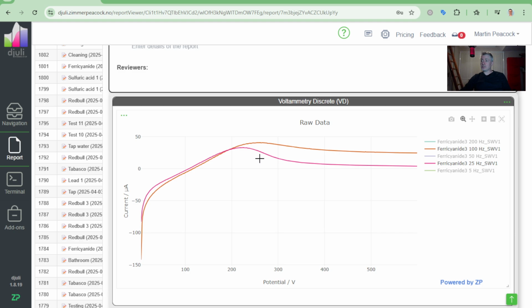Let's just look at the 100 hertz. See, the 100 hertz, we at ZP could deal with that because we'd like our assays to be quite quick. But it's a quick way of showing you that you could argue here that I've done about 1, 2, 3, 4. I did at least 4 of those experiments live in front of you. I didn't do the 5 hertz in front of you.